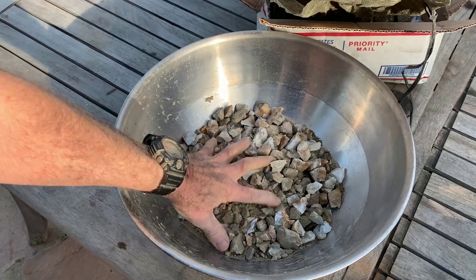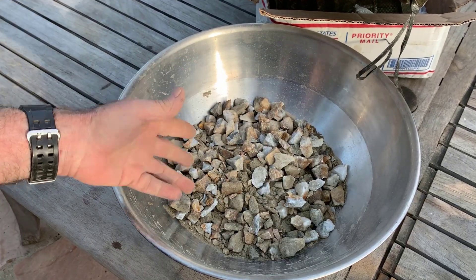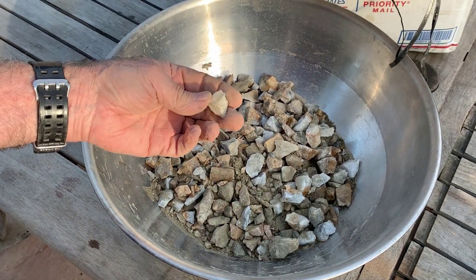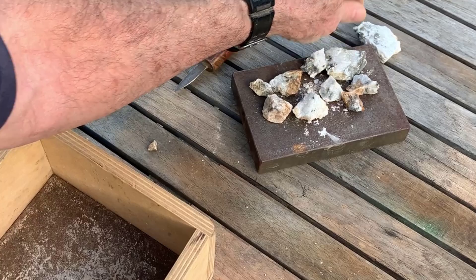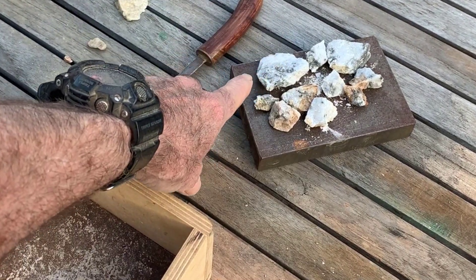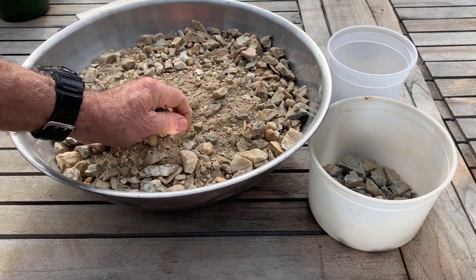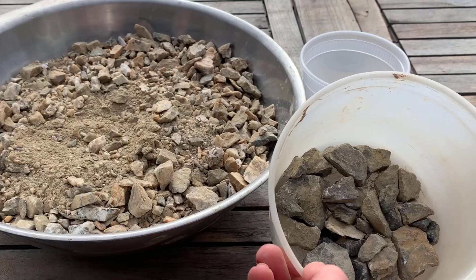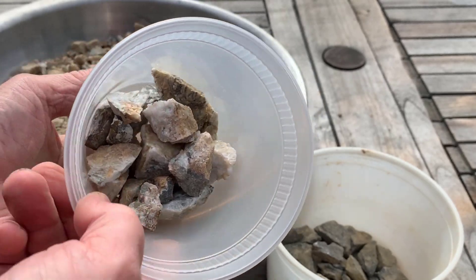I've been through most of the bag. This was the big stuff — I've crushed it up a little bit and it's small enough to go through my flail mill. I've set aside some rocks that obviously have little specks of gold. Here's what I got out of the whole thing. Waste rock — very little, half a kilogram or less. And I've got some specimens that we'll go inside and take a closer look at.